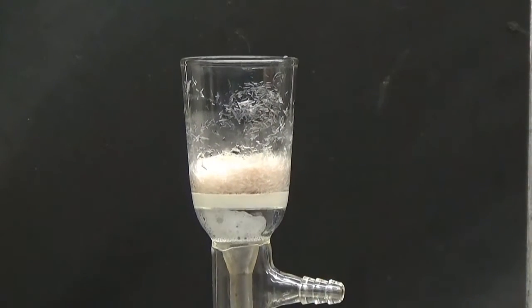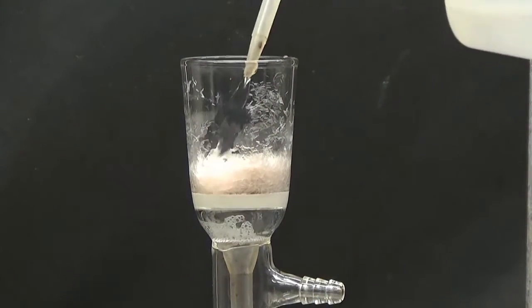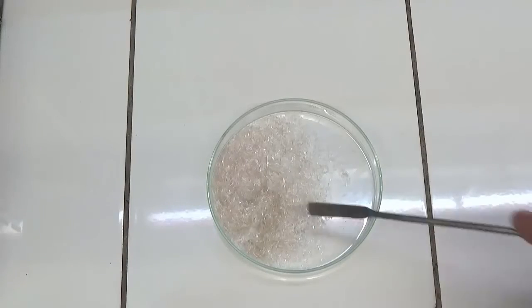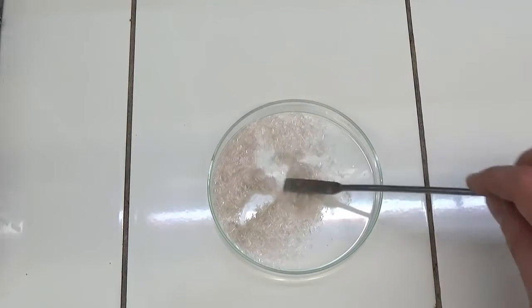Wash in chilled water once. Dry in the oven at 80 degrees.